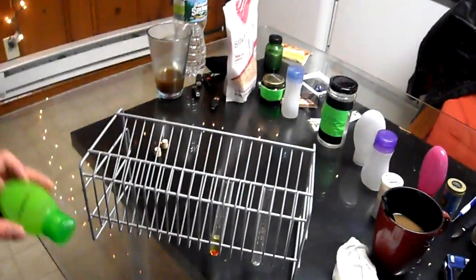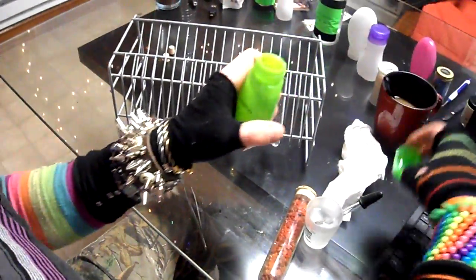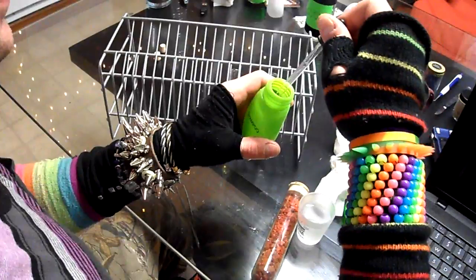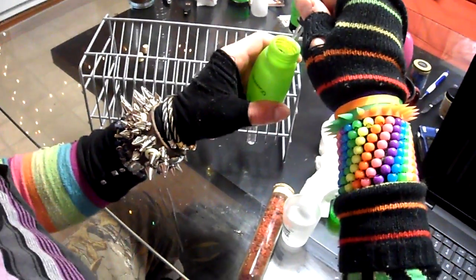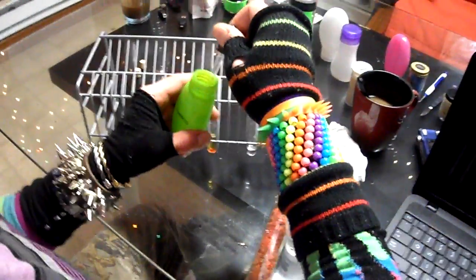Okay, now that we have that, you're going to take some of the sample water, which we obtained from the precipitation. Where was that we were at, Davey, specifically in South Carolina? That was Boiling Springs, right? Yeah, this was obtained from Spartanburg in South Carolina. Spartanburg, yeah, because that's where we were when we got here.